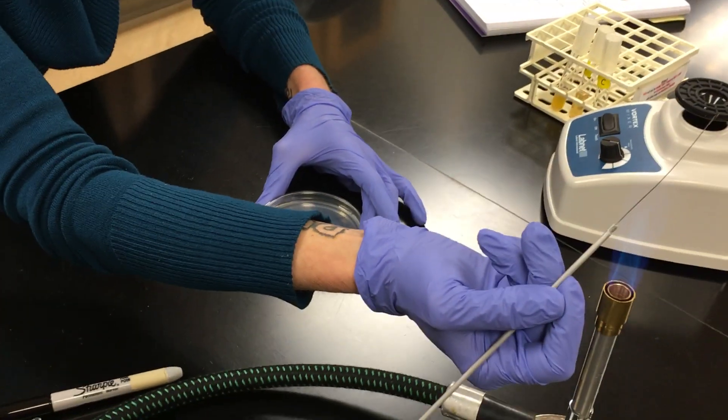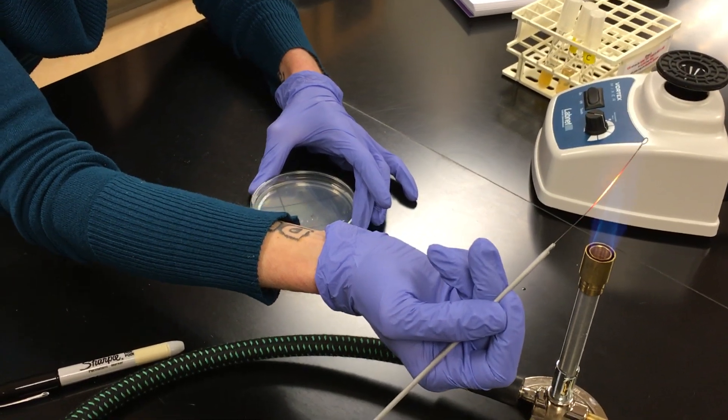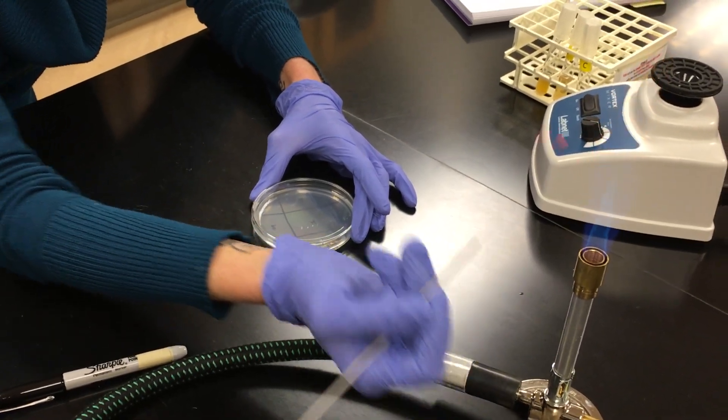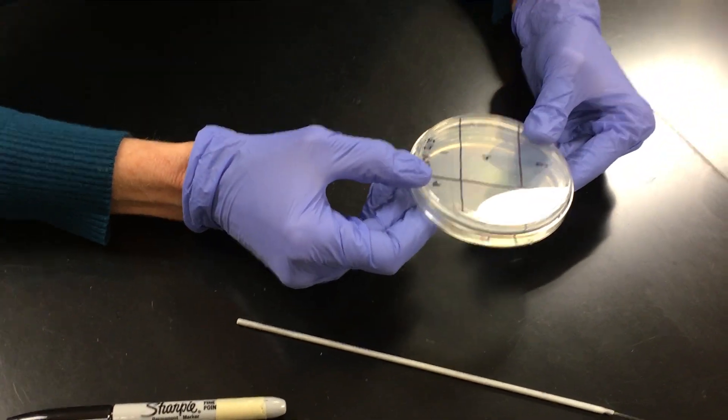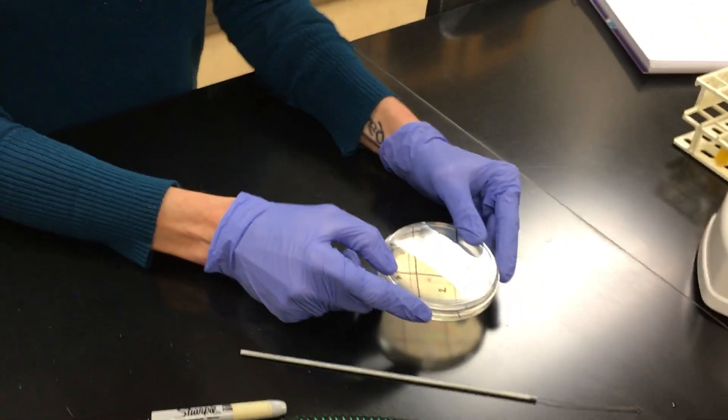I'm going to flame my loop because I don't want to contaminate the lab bench when I put it down. And now I'm going to flip my agar plate over. Now it's ready to incubate. That's it.